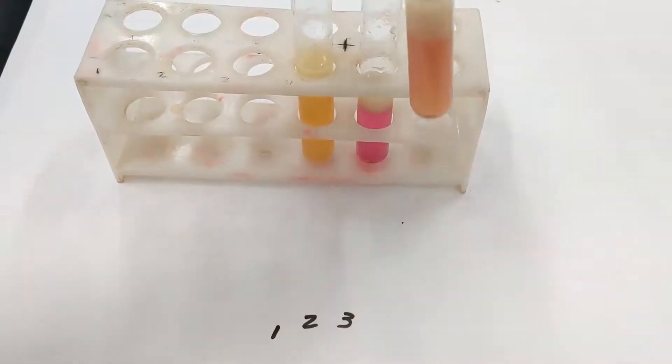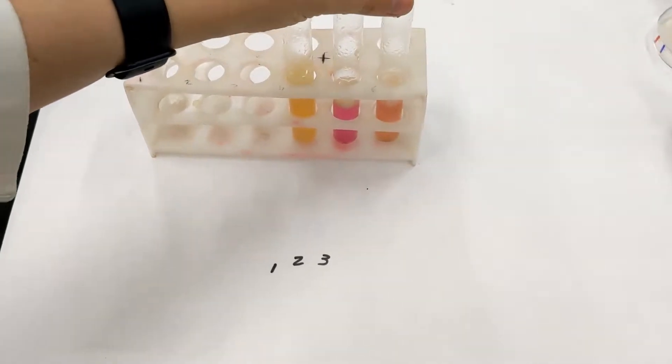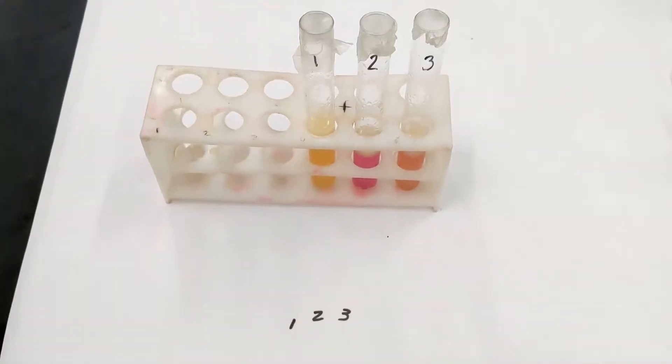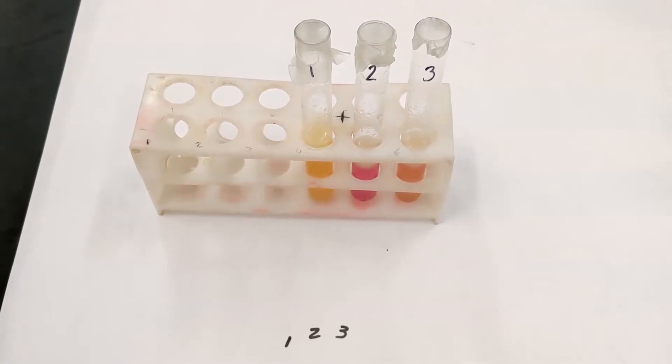The pH values were measured using our pH meter, which can be found along with the initial pH measurements in your results document.